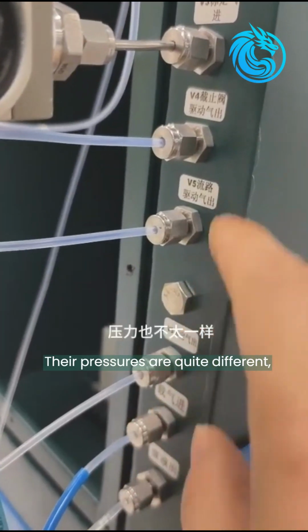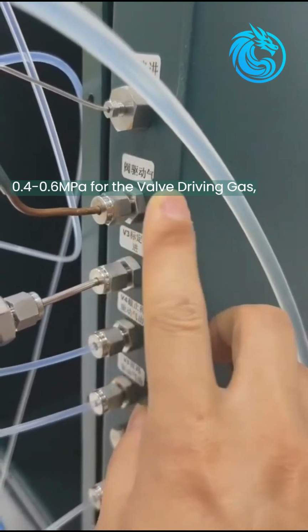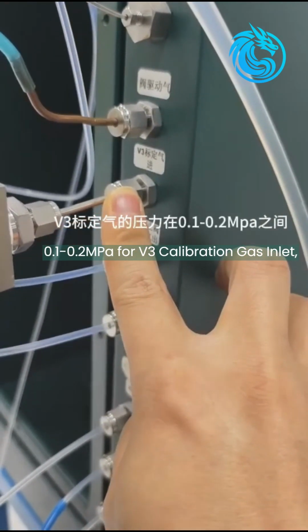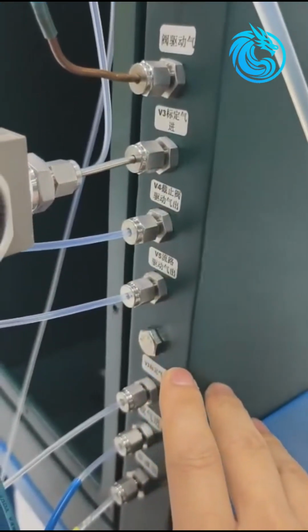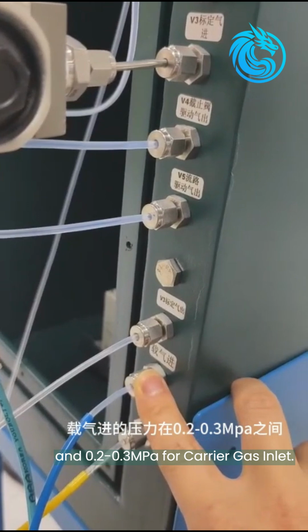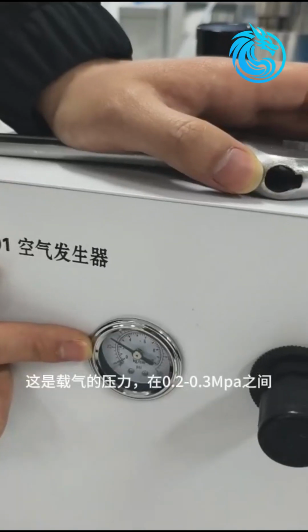Their pressures are quite different. 0.4 to 0.6 megapascal for the valve driving gas. 0.1 to 0.2 megapascal for V3 calibration gas inlet. And 0.2 to 0.3 megapascal for carrier gas inlet. Practical operations can refer to these pressure gauges.